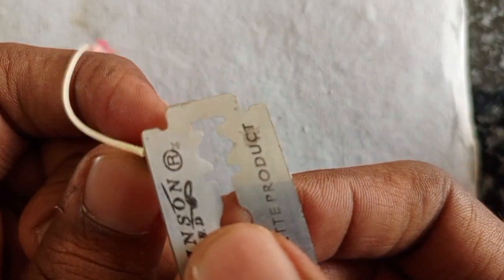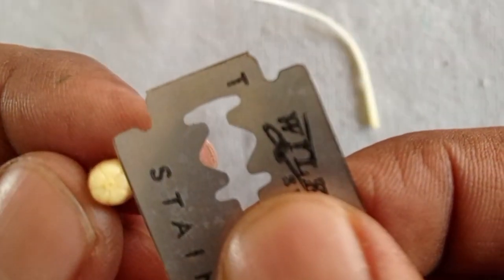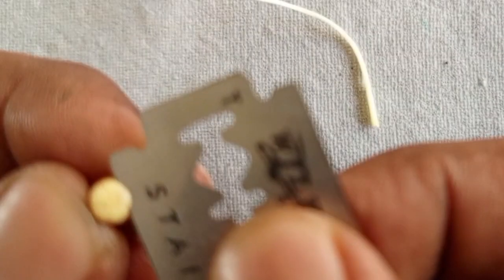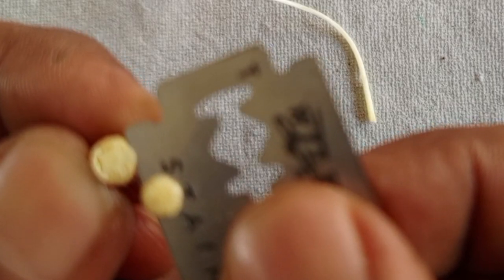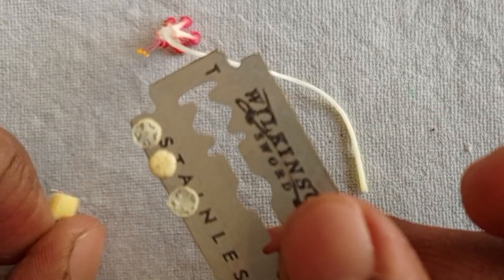With the help of a sharp blade, take sections of ovary like this. So you need a sharp blade for a good section. Okay. So you can see the locules easily here.